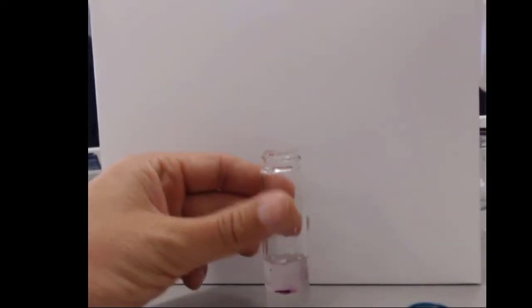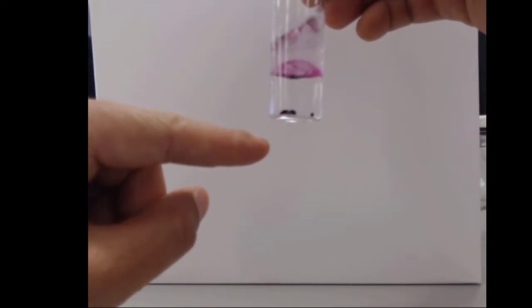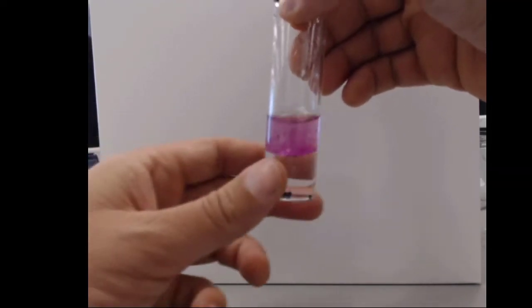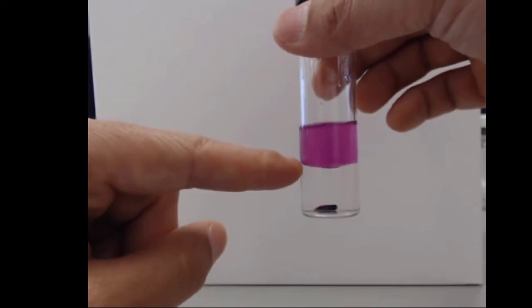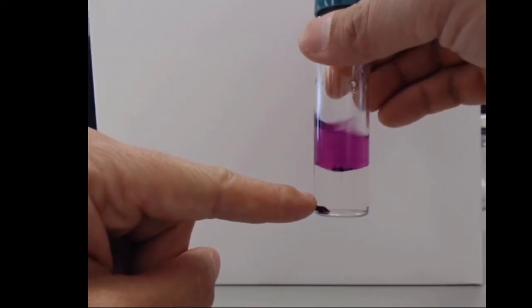Because of gravity, they sink right to the bottom. And you can see the iodine crystals down at the bottom just kind of sit there and slosh around. You can already see some purple from the pouring through. Now here's what we're going to do. If I shake this up a little bit, we get a little bit of purple up there from the iodine crystals dissolving in the top, and no purple in the bottom.